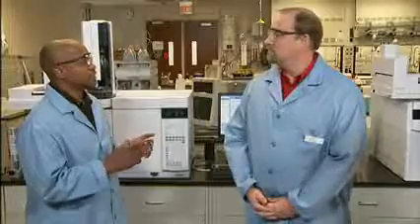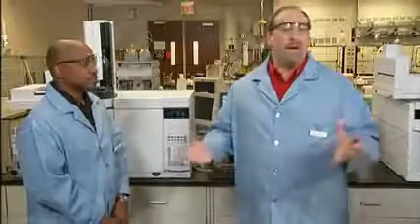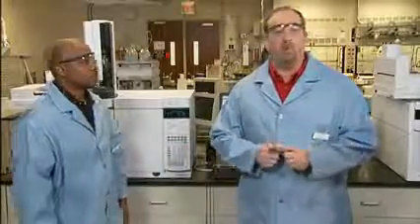What else should we consider? Well, one of the first things I might check if you're having baseline noise, just to make sure, is the detector gas flow rates. I'm sure you've seen this as well, but sometimes the flows aren't set to the recommended values. Someone was trying to optimize things or didn't even know they were changing them, and they're just wrong for some reason. Again, your GC manual will tell you the right flow rates for your instrument. Herb, could you show us how to set and verify the flows for the FID?